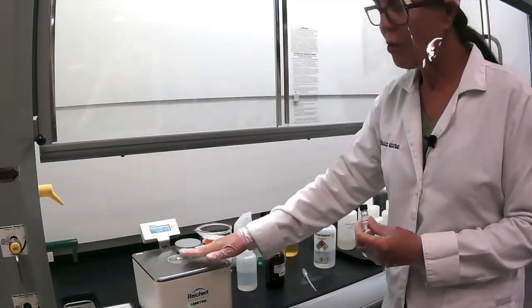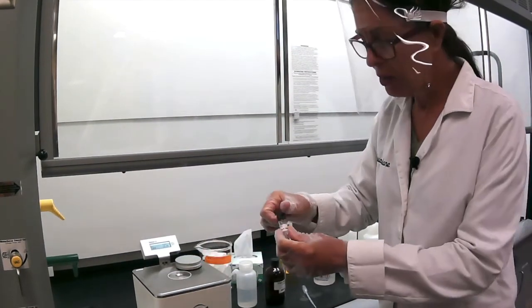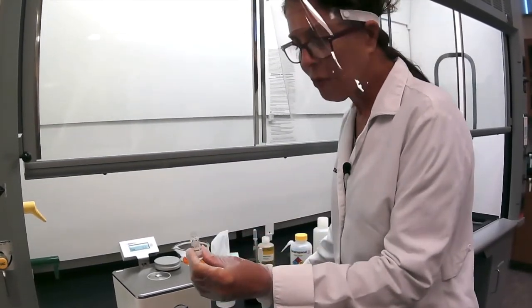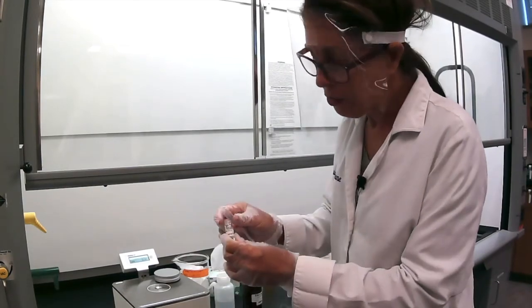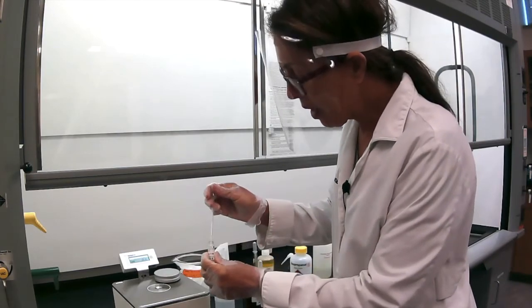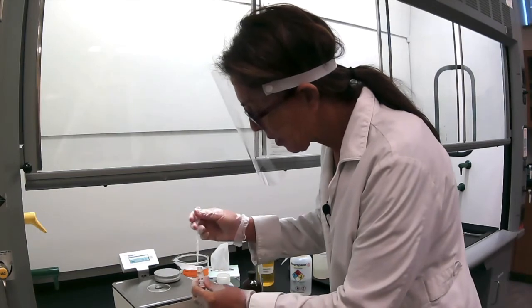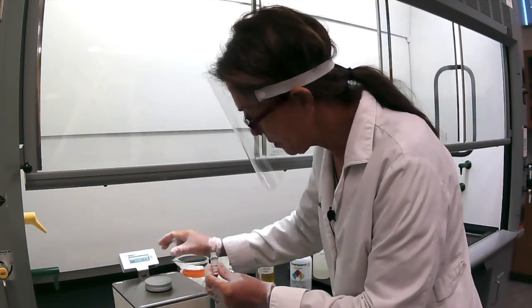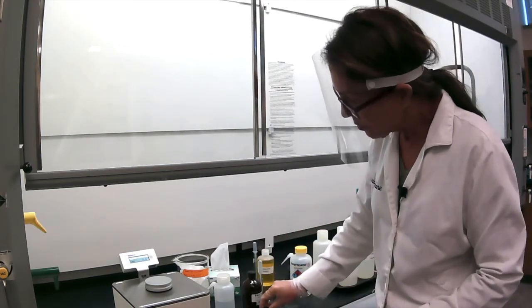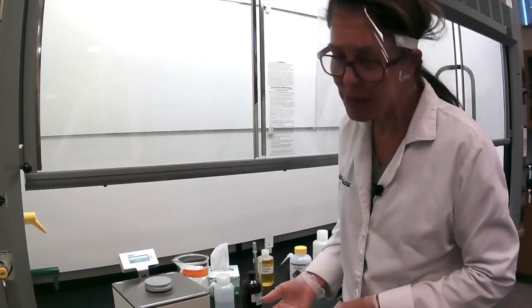Same thing. First of all, dry. You have to clean this container, the hole there, and then you're going to put your unknown in there. Your unknown has to be liquid, of course. And don't forget to write your unknown number. We always have to write the unknown number. And then you fill it up to the brim. Okay? Then you cover and you read. So here we go. Our unknown is 1.3960.